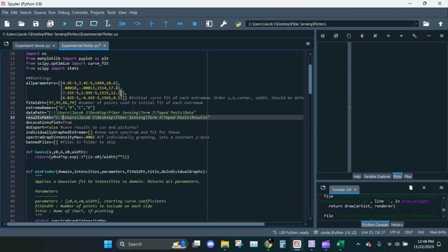Okay. Let's talk about some other parameters here. Do locations plot is just telling it that I want to make those nice locations over temperature kind of final pictures that you're familiar with. So we want that. Do export. This is going to save all the results to CSVs and save the pictures. I don't want to do that until I make sure everything's working, we're not getting errors. So I'm going to save that false for now. Individually graphed extrema. If one of your extrema are looking a bit strange and you want to check how the curve fit's applying to them, you could run that function. Maybe I'll show you what to do later. For now, I'll leave it blank.